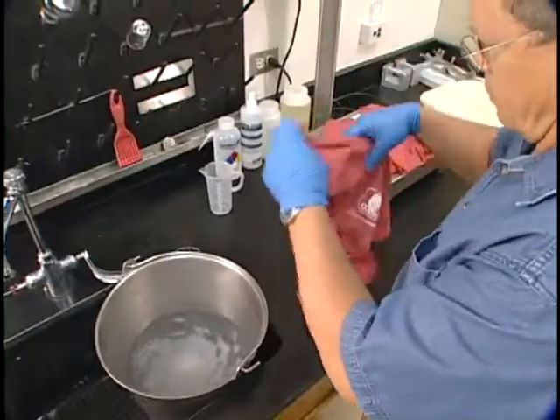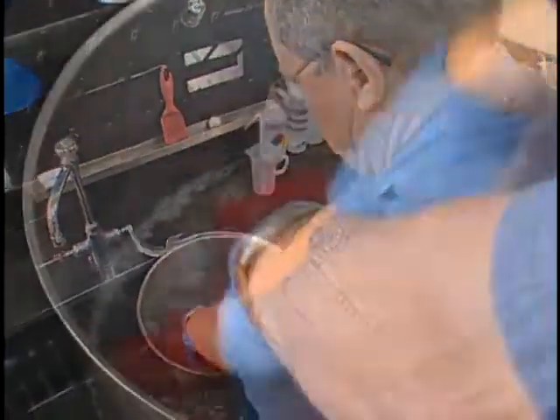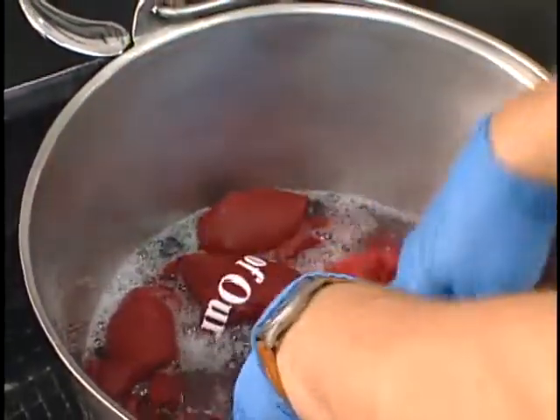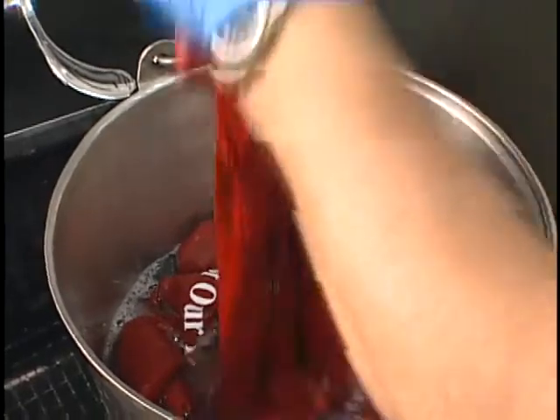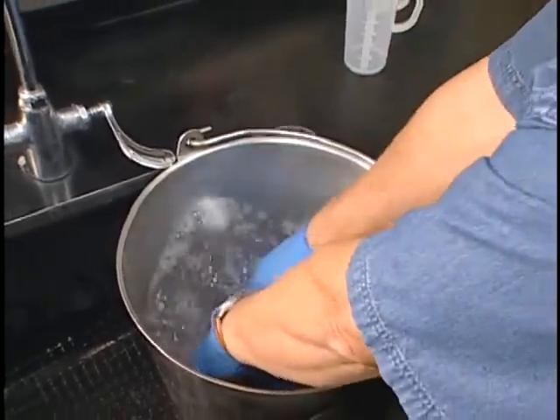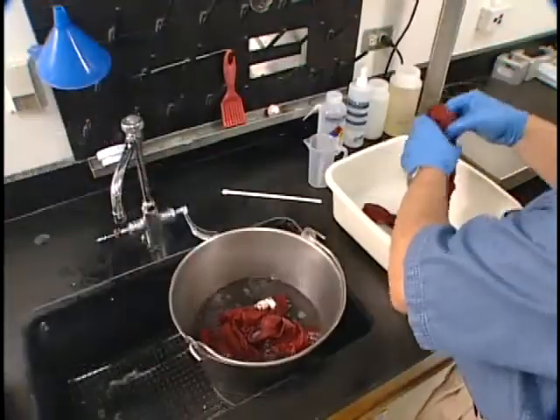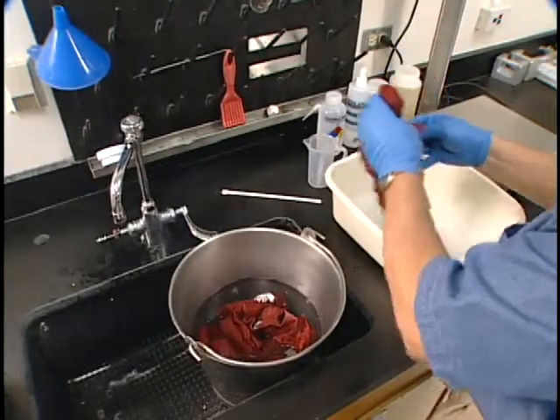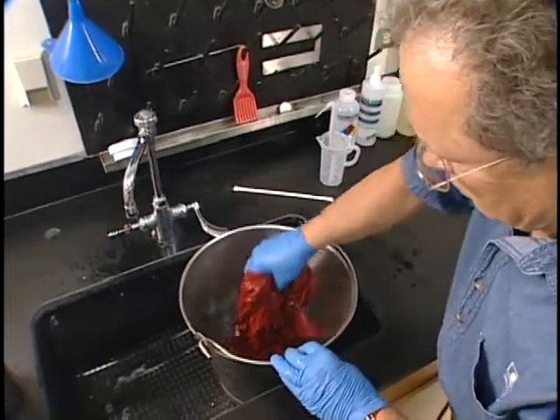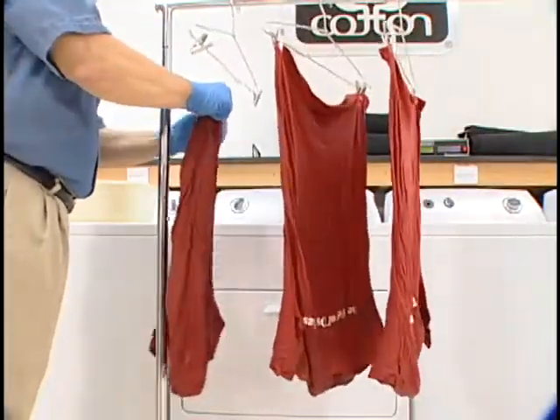Hand washing uses a standardized 10-quart pail along with three fabric test specimens. A prescribed amount of AATCC standard reference detergent, powder, or liquid is dissolved in two gallons of water in the pail at a temperature of 105 degrees Fahrenheit plus or minus 5 degrees. The specimens are washed for two minutes without any twisting or wringing. A single rinse follows, and then the specimens are removed and drip dried.